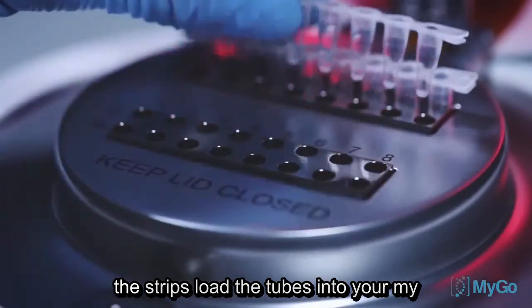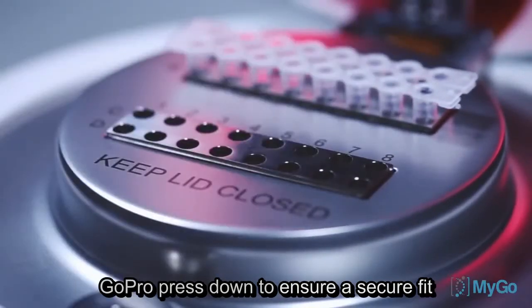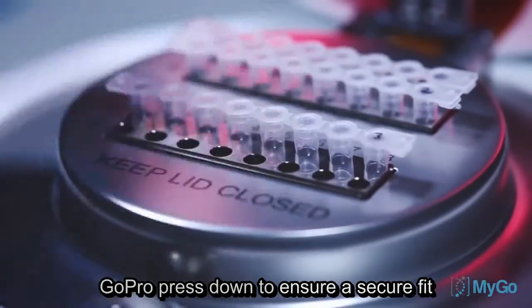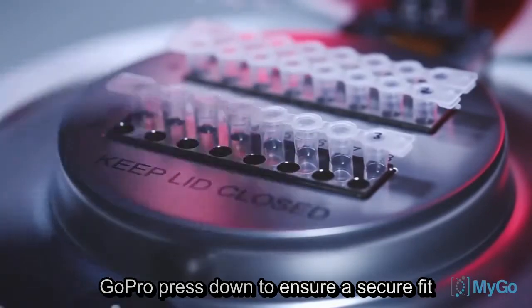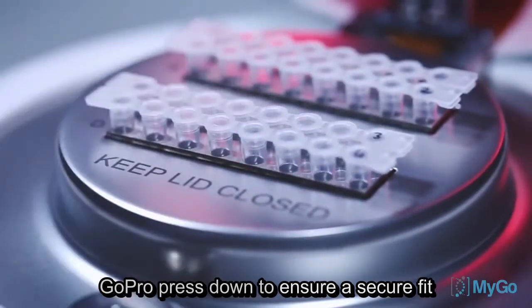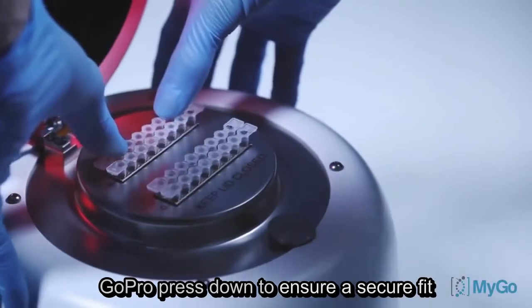Load the tubes into your MYGO Pro. Press down to ensure a secure fit.